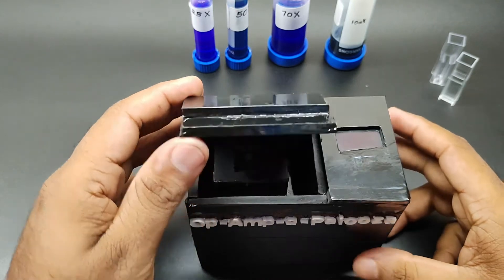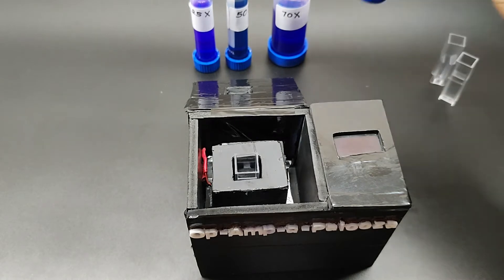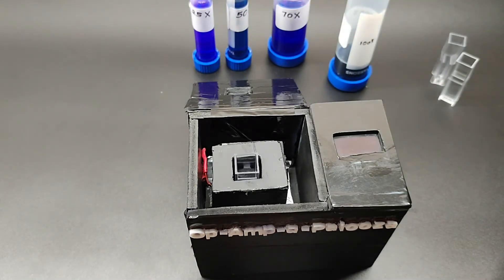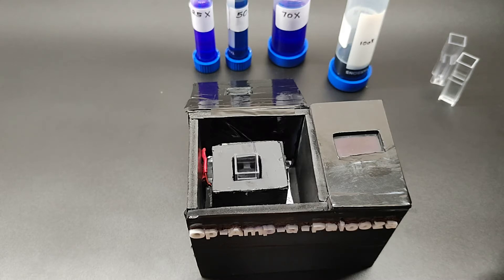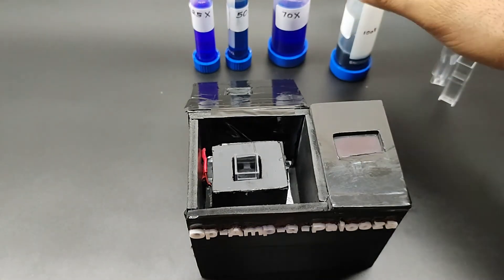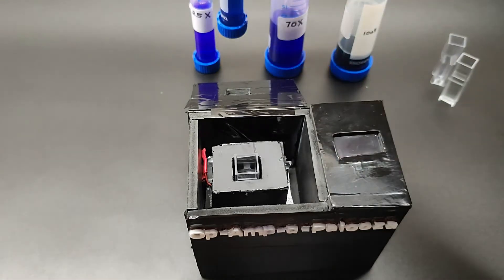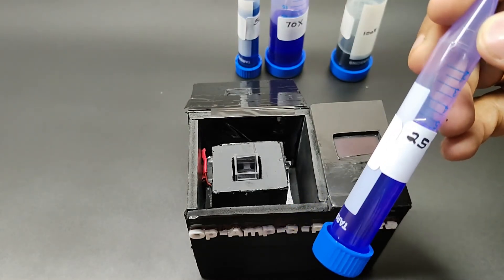In this experiment I am going to use Coomassie Blue. I diluted the Coomassie Blue in different ratios to test the absorbance using the spectrophotometer. I am going to use the 100x, 70x, 50x, and 25x liquids. The 100x is the undiluted liquid, the 70x is a 30% diluted liquid, the 50x is a 50% diluted liquid, and the 25x is a 75% diluted liquid.